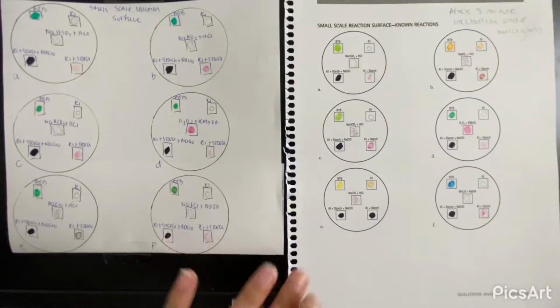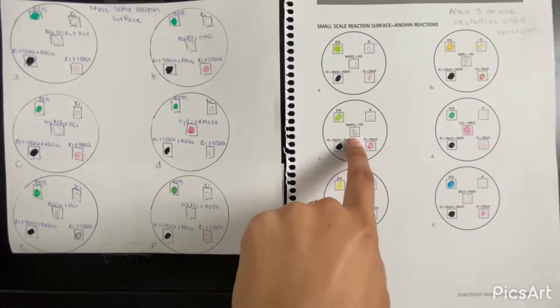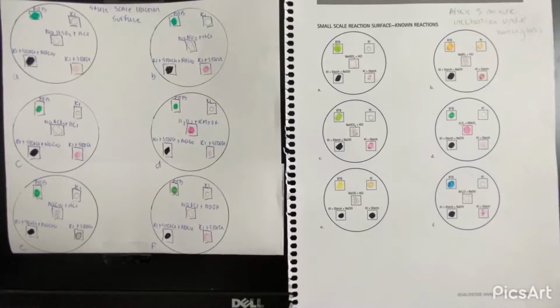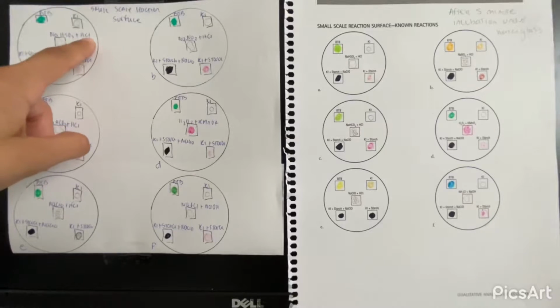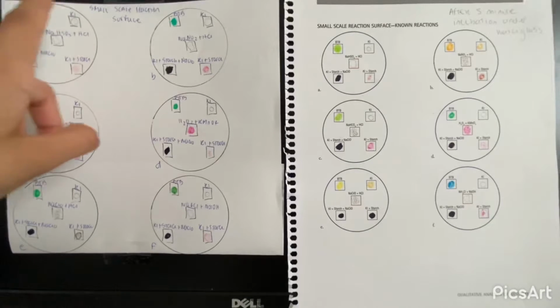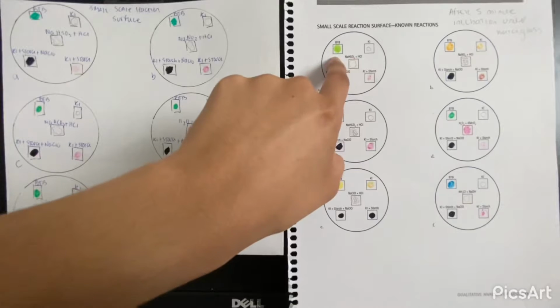If we have presence of gases, that's going to be in the presence of bubbles. If we see bubbles, that means we have some gases. So starting with A, chemical reaction is NaHSO3 plus the HCl. Our BTB starts being a strong green, and after the 5 minutes that we incubate, we have a light green.